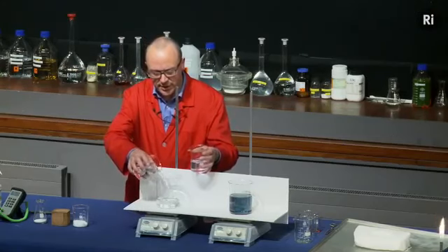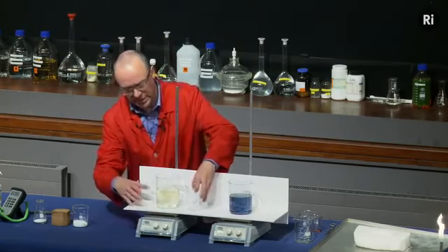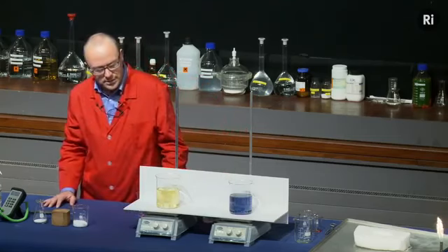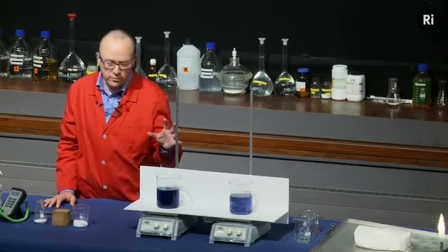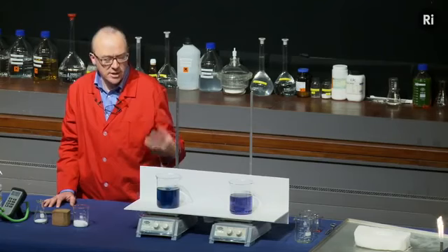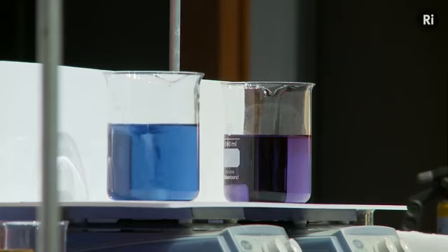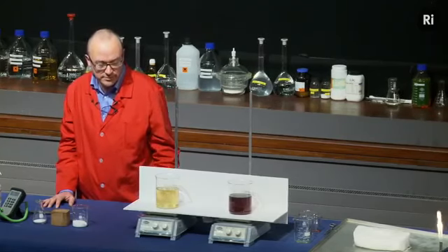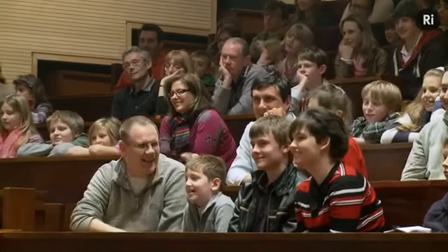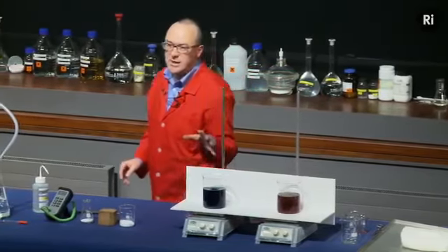So again, I have a clear liquid, I add a second clear liquid, and a third clear liquid, and it turns amber. We'll keep watching, and it turns blue, very dark blue. So that's a little bit like the clock reaction. It's the same thing, it's the reaction between starch and iodine. But this time, it doesn't stay blue, it's going clear again. So it's become clear, now it's going back to amber, and if we keep watching, back to blue again. Okay, so those are two oscillating chemical reactions.